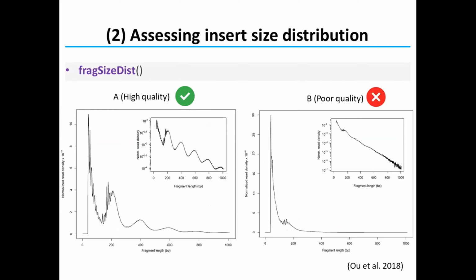On the left side is the size distribution for a high quality ATAC-seq library. From here you can see many reads are from the nucleosome-free region, which has a small fragment size less than 100 bases. Then you can see the mononucleosome associated fragments, and the dinucleosome, trinucleosome, even tetranucleosome associated fragments. On the right is the size distribution for a poor quality ATAC-seq library. Basically, you can barely see fragments greater than 200 bases. This is probably due to over-transposition of the chromatin.